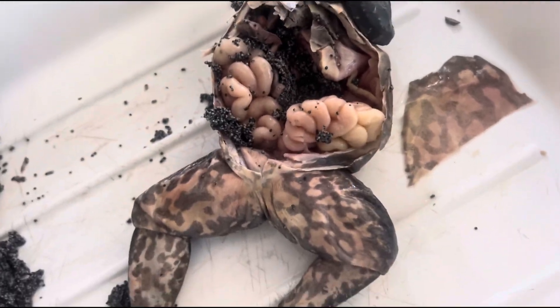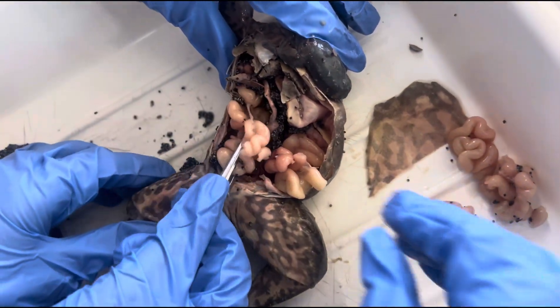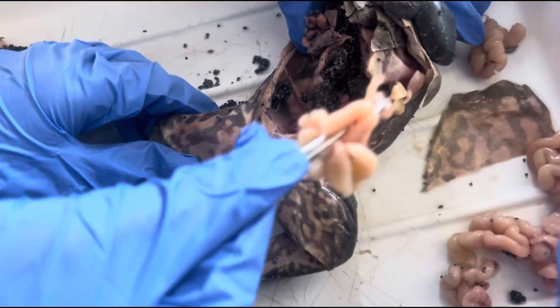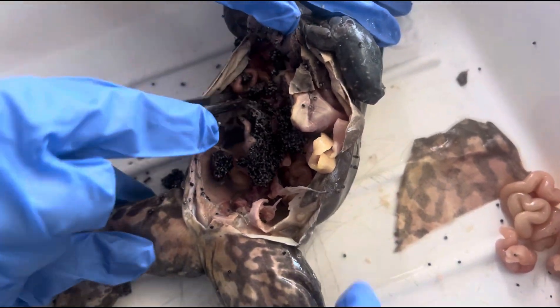Go all the way up. So there's the eggs — can you move the eggs to one side in the corner? Which one's the forceps? The forceps is like a tweezer type. Go on, take them out, start taking them out, pull them into the corner. Oh, it's cold. You're dead! What the hell? So this feels grim. Now start looking at the heart, start taking the heart out. That feels so nasty. Just keep cutting.